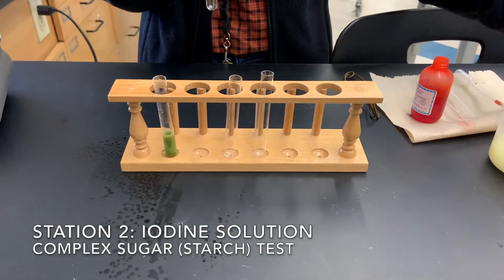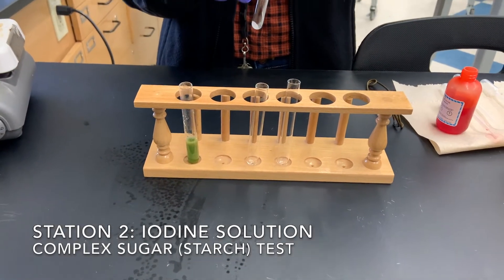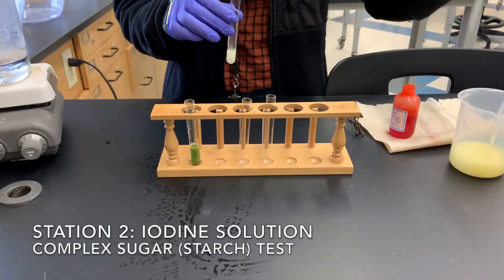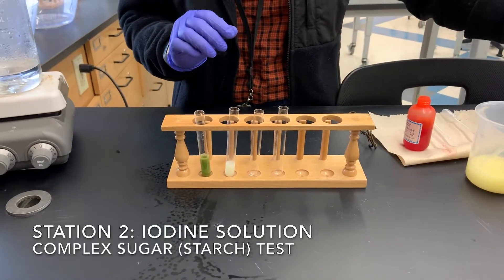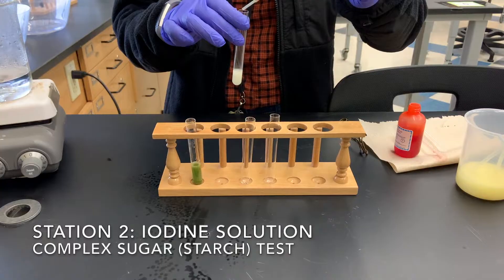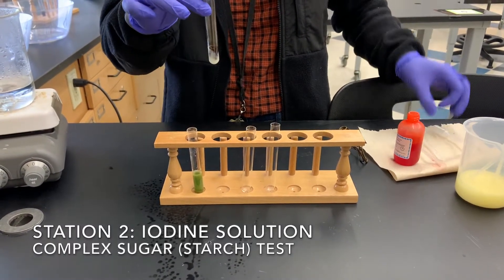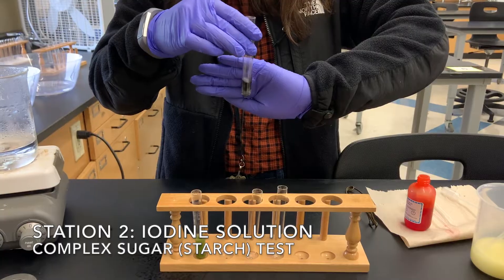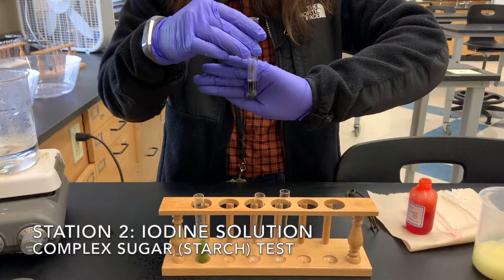Now instead of using water, we'll use our victim's stomach contents — two milliliters — in the test tube. And now we're going to test for starches using iodine. We put two drops of iodine in here, and you can see it's turning a purple-black color. So the result for test two for starches is that purple-black color.